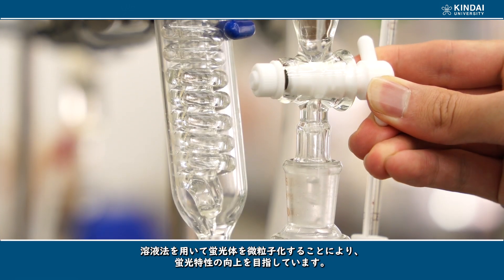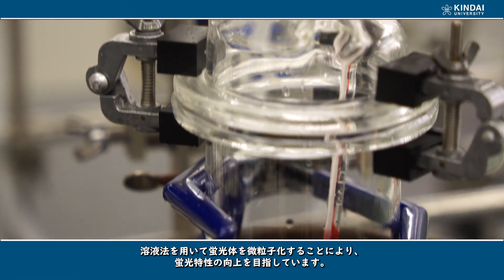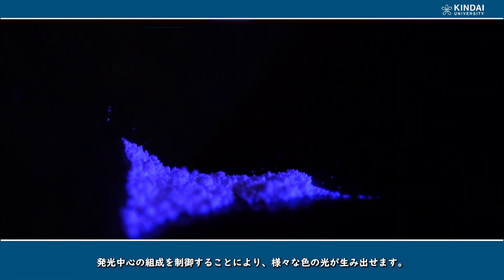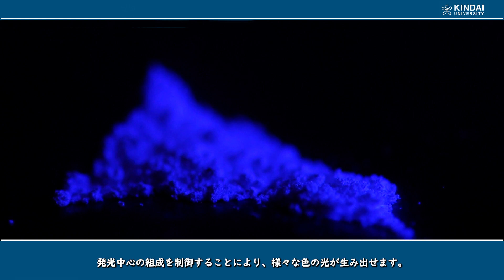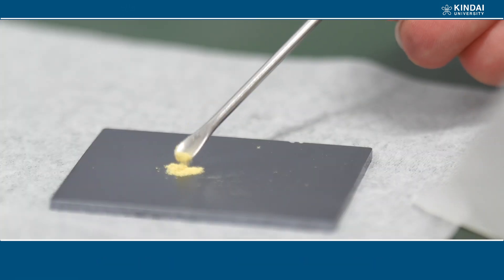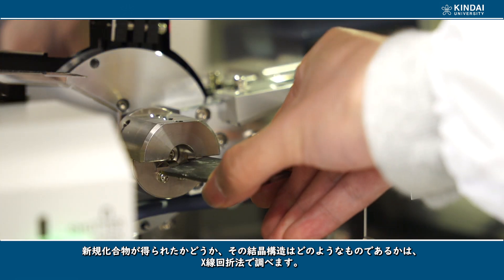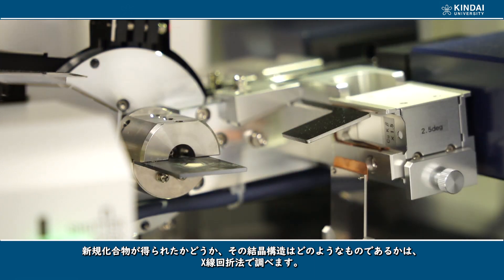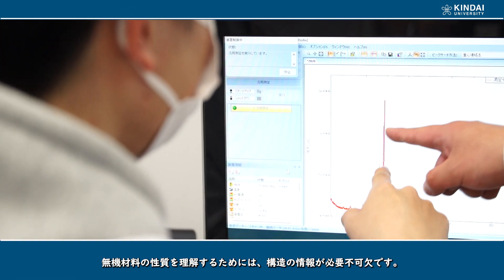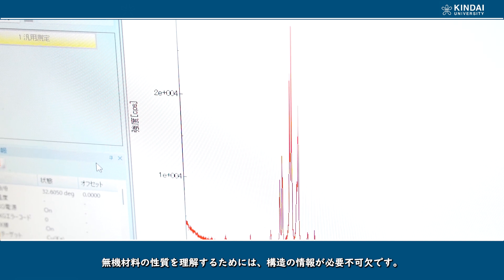Here, researchers are trying to improve the fluorescence properties by synthesizing phosphor nanoparticles. You can also produce light in various colors by controlling the compositions, including luminescent centers. The X-ray diffraction technique is used to check the production and crystal structure of newly synthesized compounds, because structural information is indispensable for understanding the functional properties of inorganic compounds.